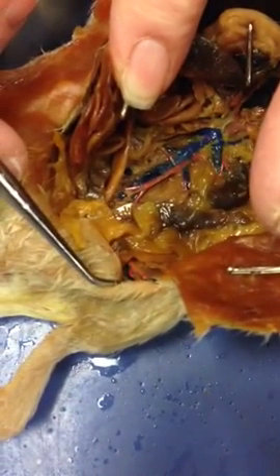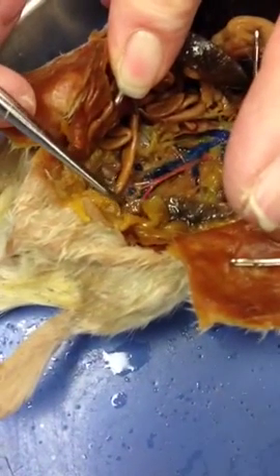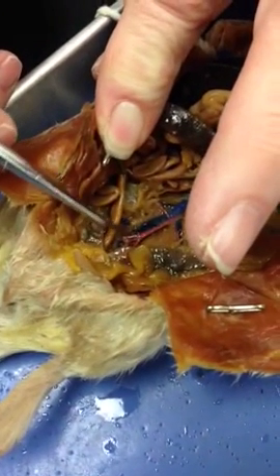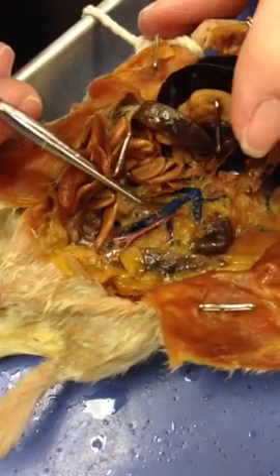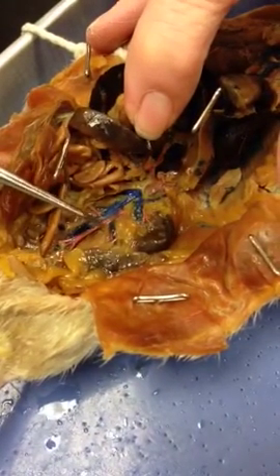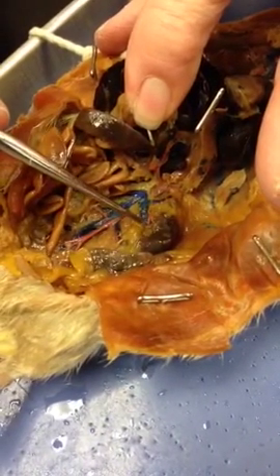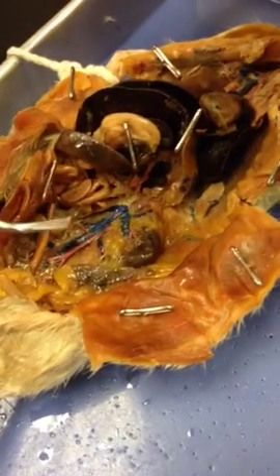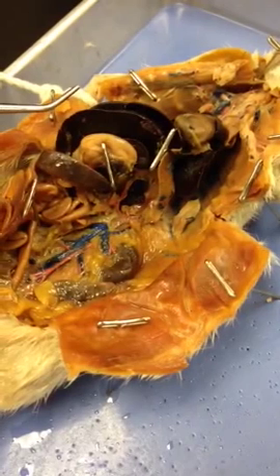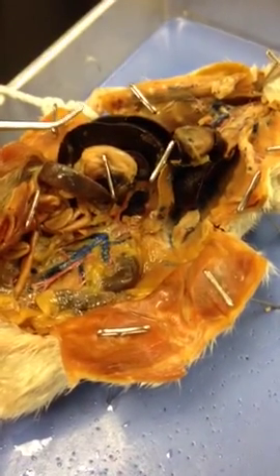Now, you have the femoral vein right by the femoral artery. You have the iliac veins right by the iliac artery. You have the inferior, or in the case of the rat, posterior vena cava. You have the gonadals. You have the renals. And we can't see the hepatic portal system because it's not stained. If we got them triply injected, then it would show up nice and yellow, but we didn't get them triply injected.